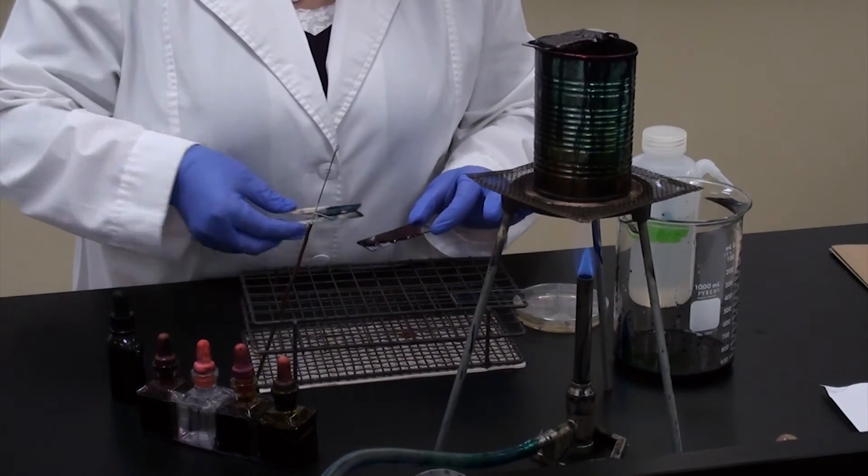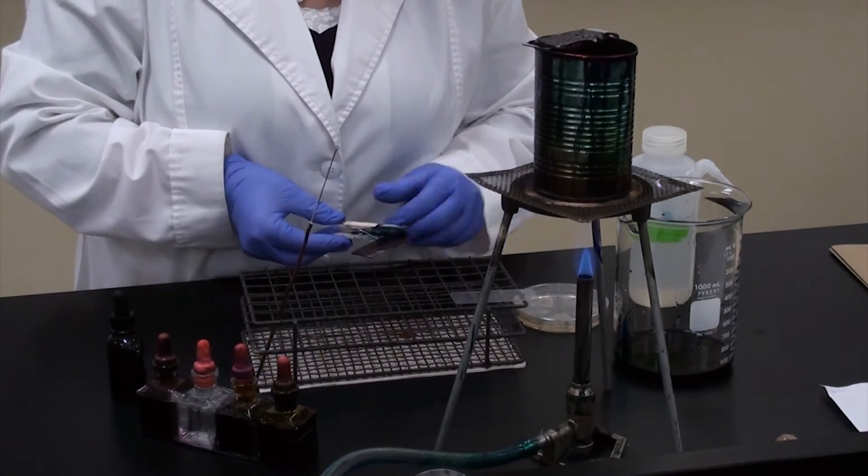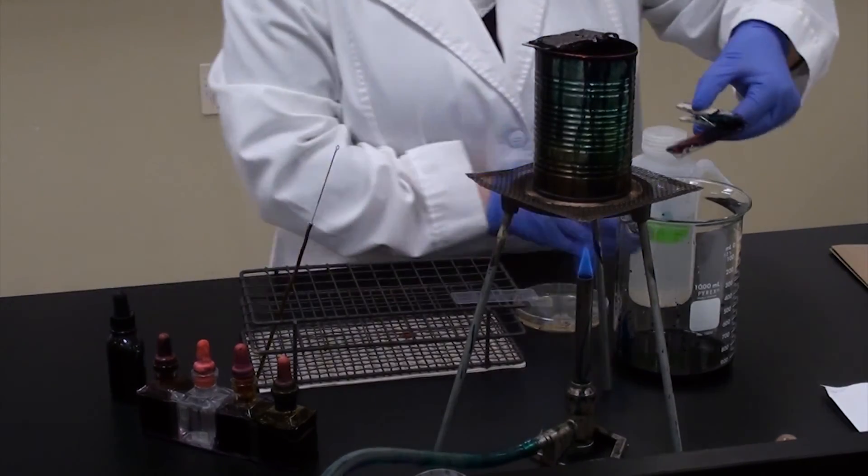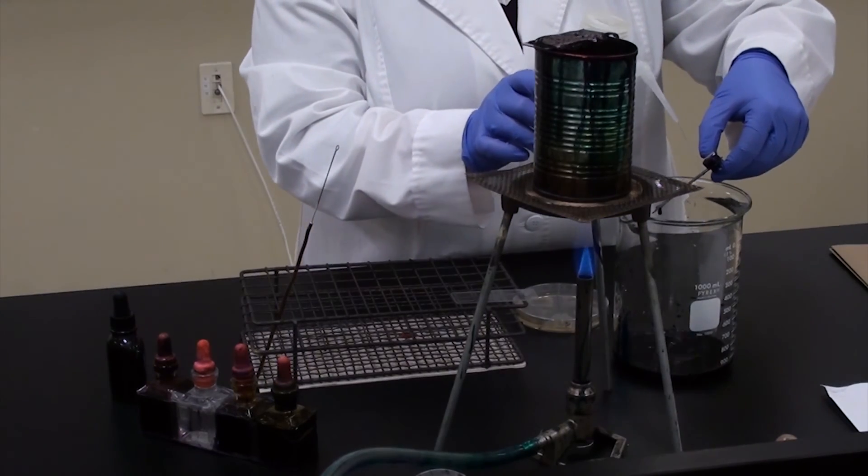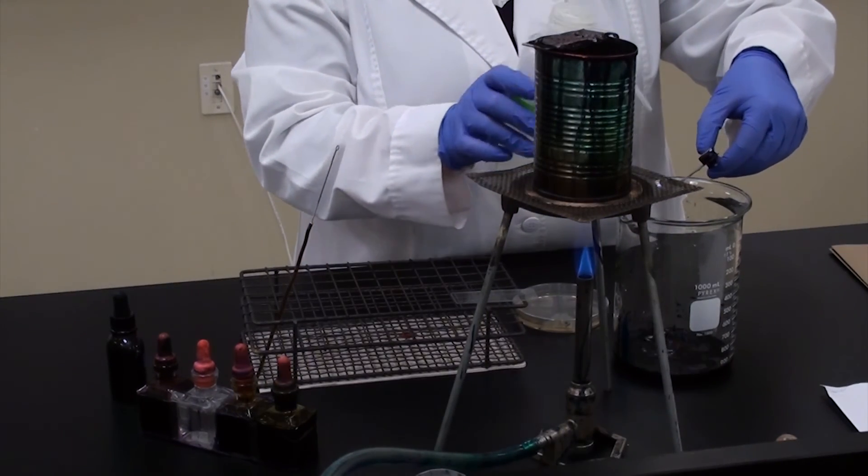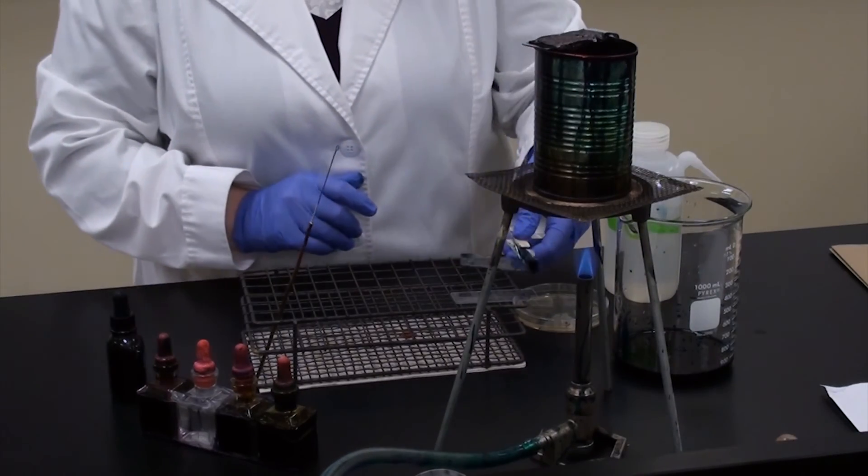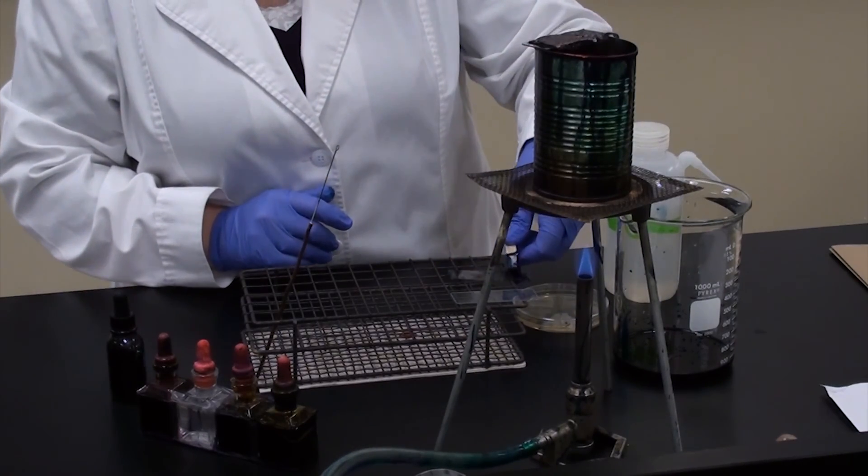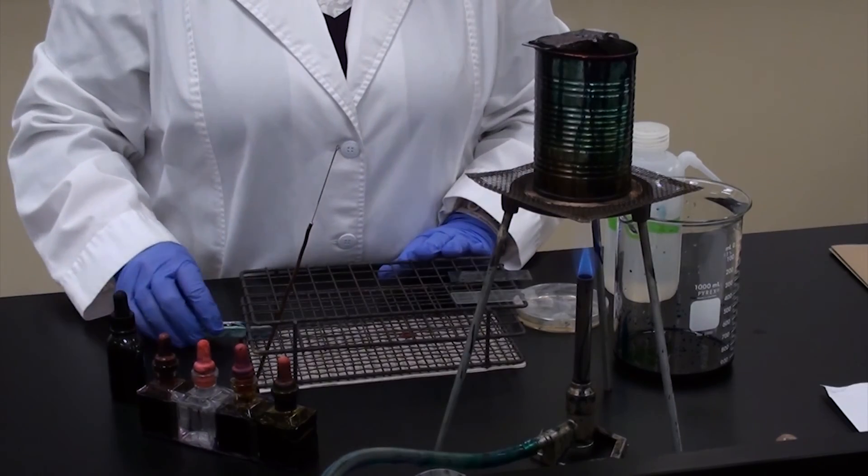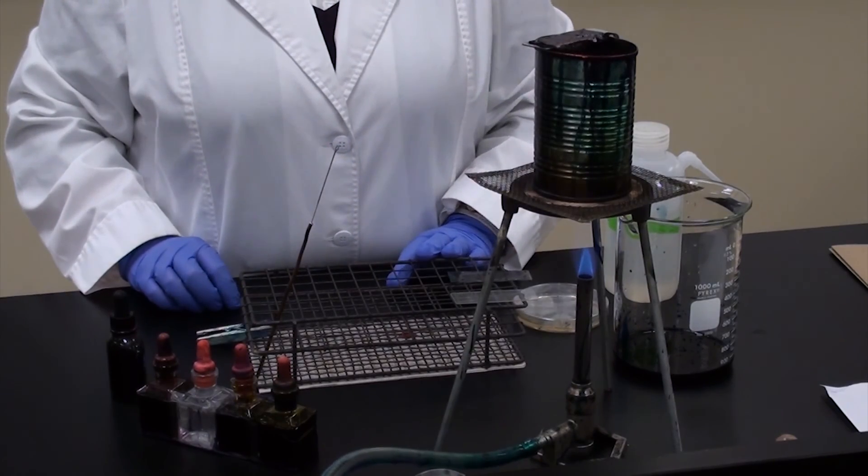Once it is completely ready, you've waited 30 to 60 seconds, gently rinse your slide again and let it finish drying. Once the slide is completely dry, you're ready to visualize. And that's it. Endospore stain.